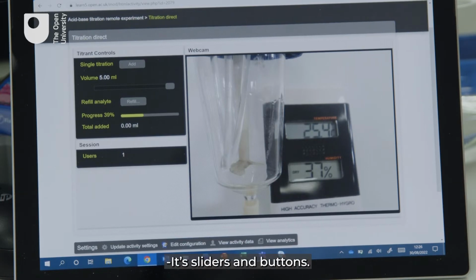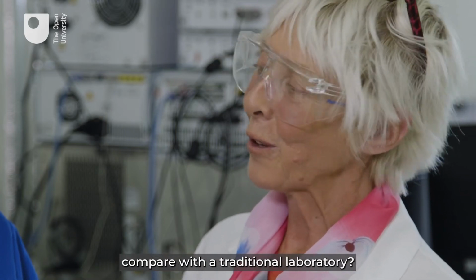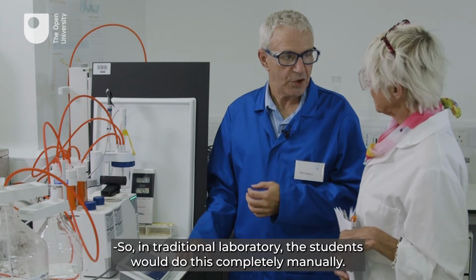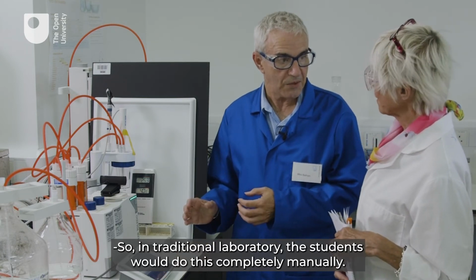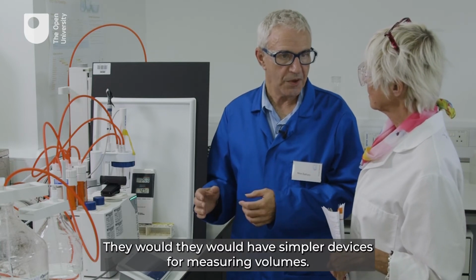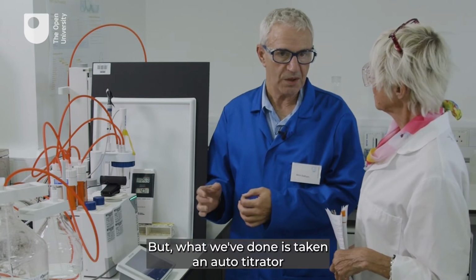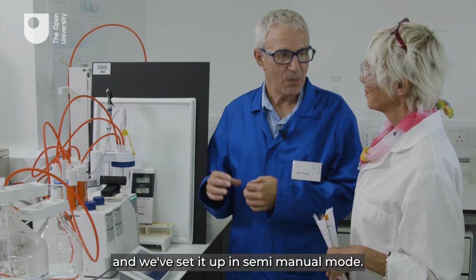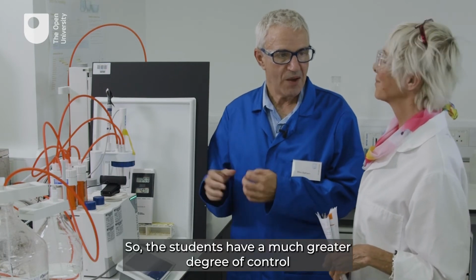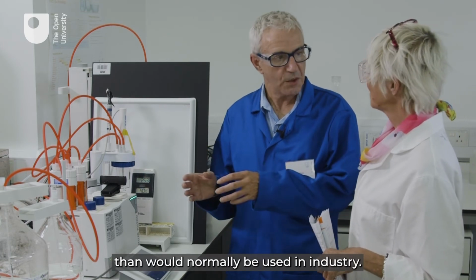Sliders and buttons. How does this way of working compare with a traditional laboratory? So in a traditional laboratory, the students would do this completely manually. They would have simpler devices for measuring volumes. But what we've done is taken an Autotitrator and we've set it up in semi-manual mode. So the students have a much greater degree of control than would normally be used in industry.